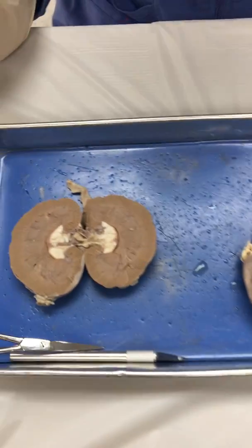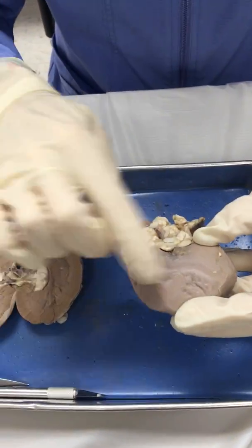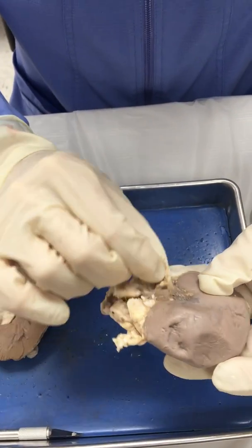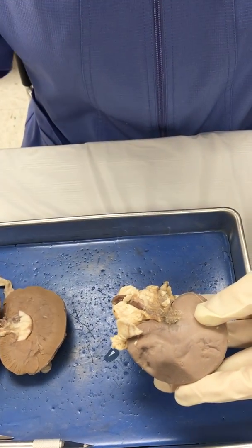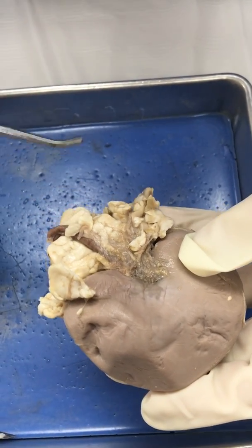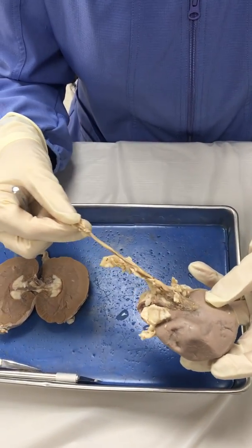So we'll come over here. This is a pair of kidneys from the sheep. This is an intact one. You can see they're kind of kidney bean shaped — that's probably where the name kidney bean came from. This was a chunky little sheep with a lot of fat around here. Let's pull some of that back so we can see the hilar region, which is the area where the renal artery goes into the kidney. The renal vein leaves, and also this long tube here is the ureter coming out, which transports the urine into the urinary bladder.